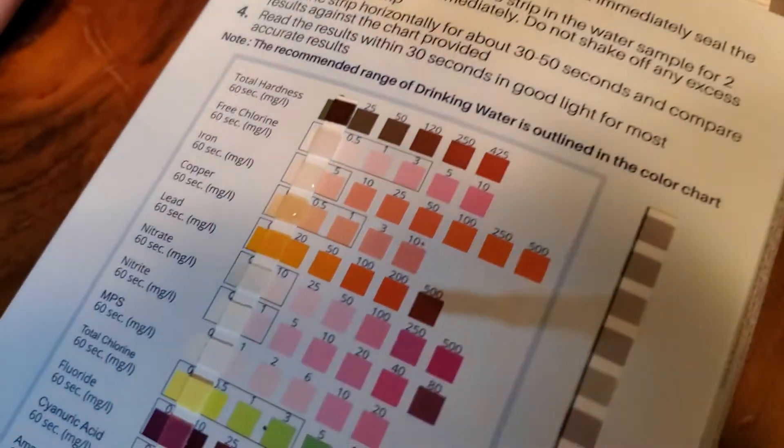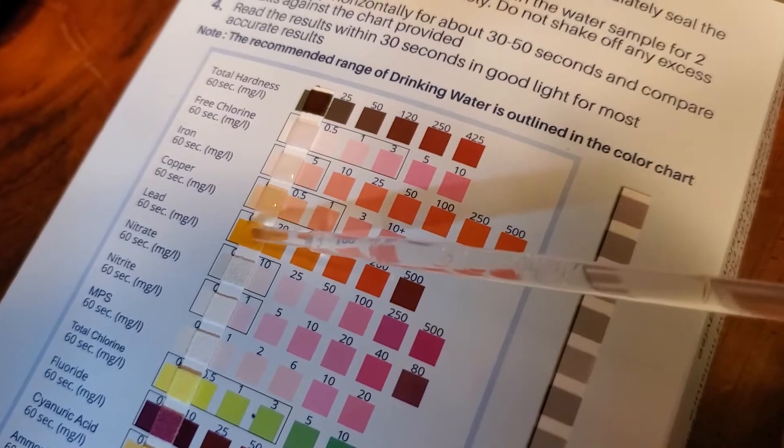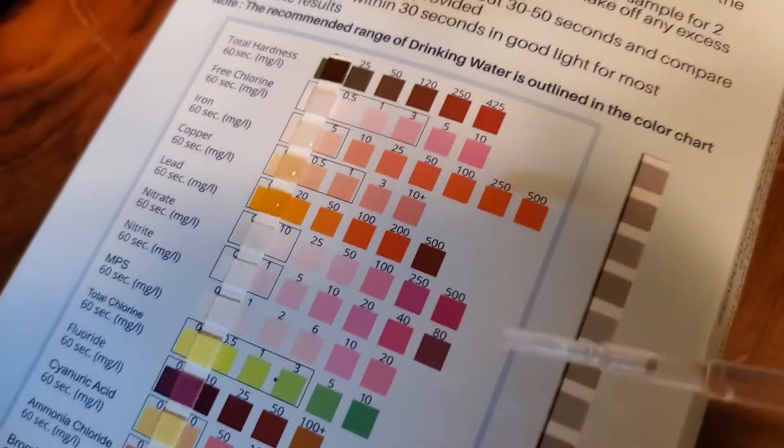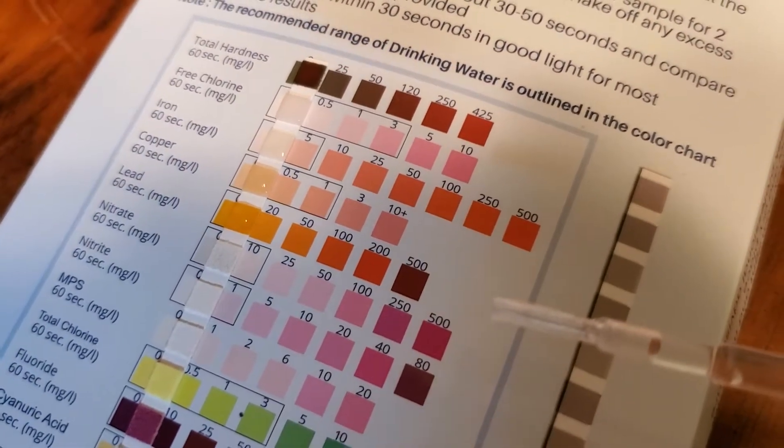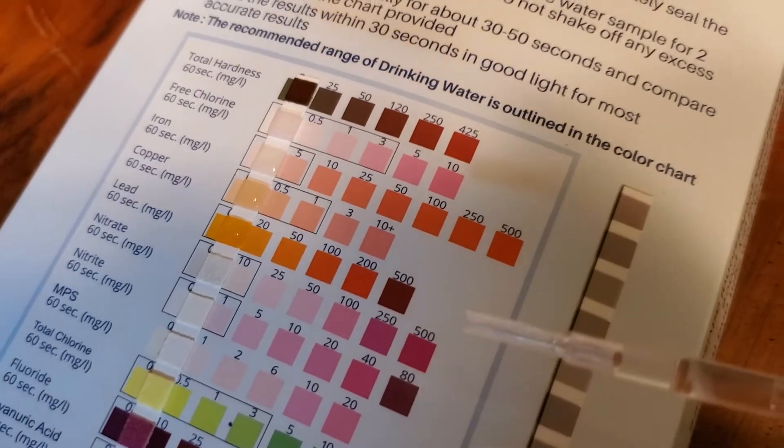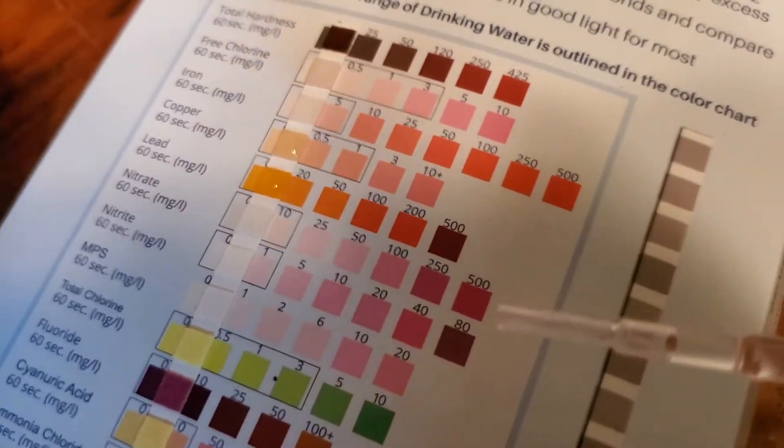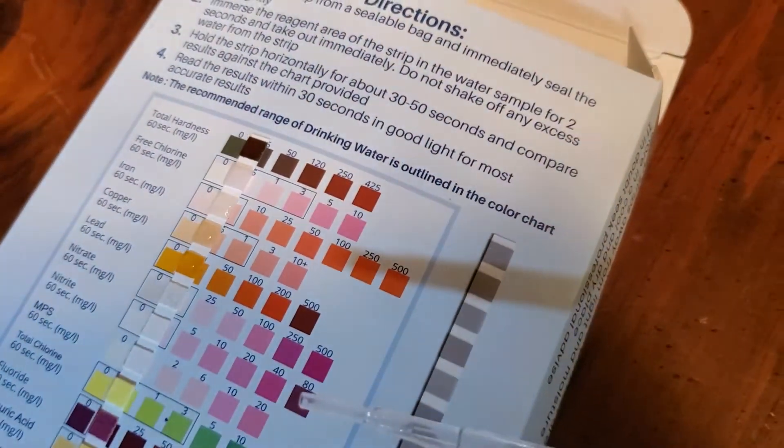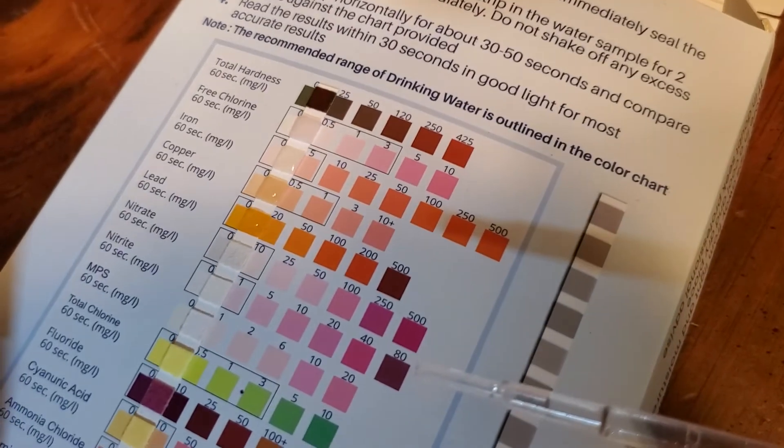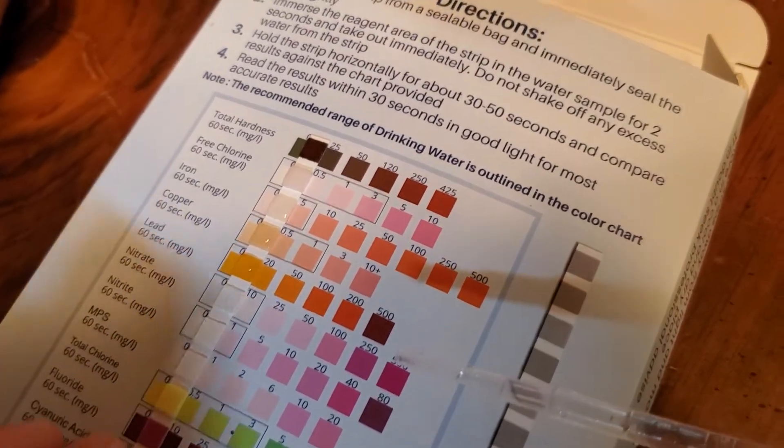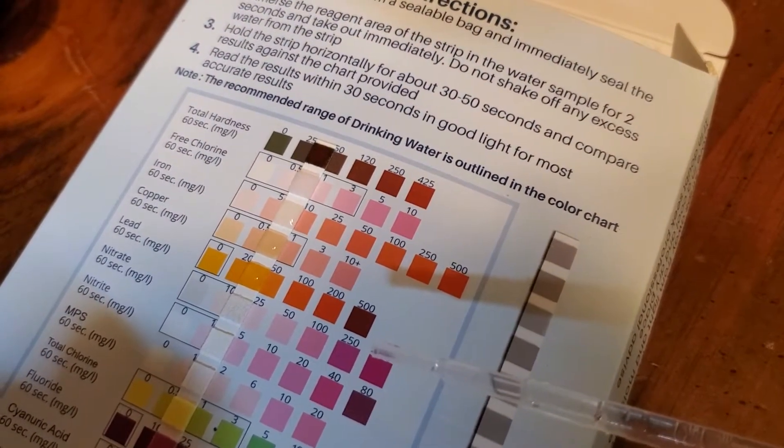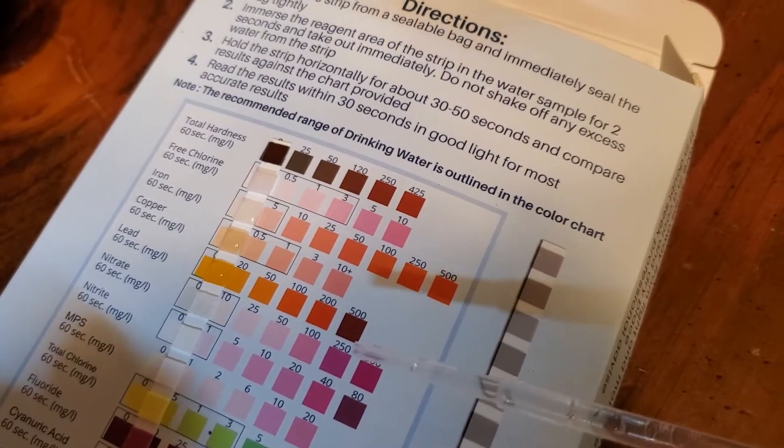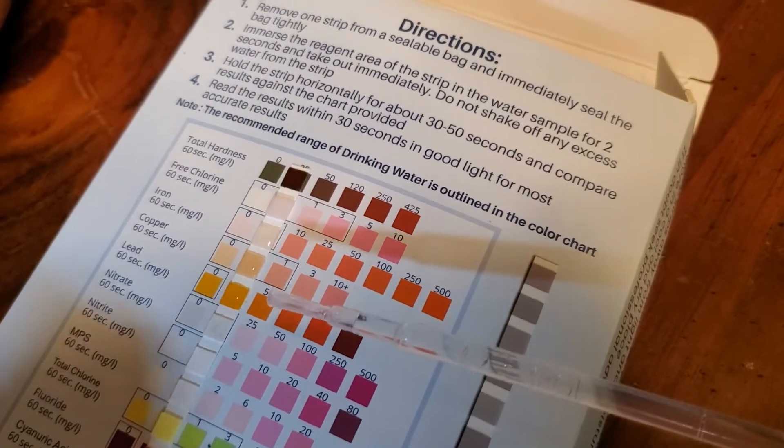Now lead. This one is really rough because there's like no difference between those two bottom colors. If this one gets slightly dark that's when you call in somebody to test your water. I don't see any difference between the bottom one, the zero and the 20. It's either zero or 20, either we've got lead in our water or we don't. But when you put it here it definitely looks lighter than the 20. I'm thinking maybe a little bit over the zero but we should probably have that tested.